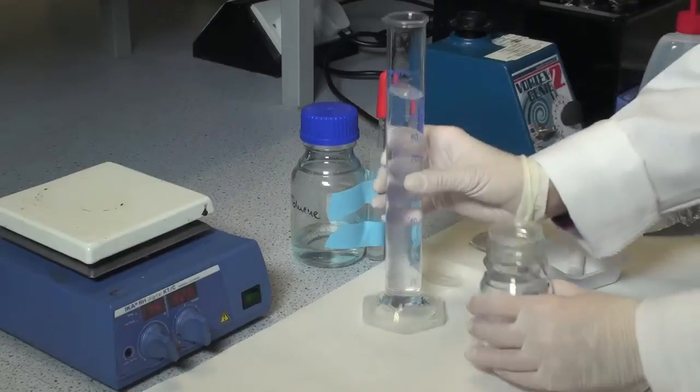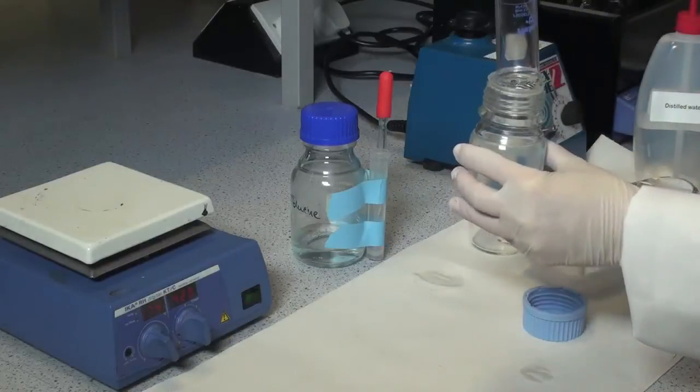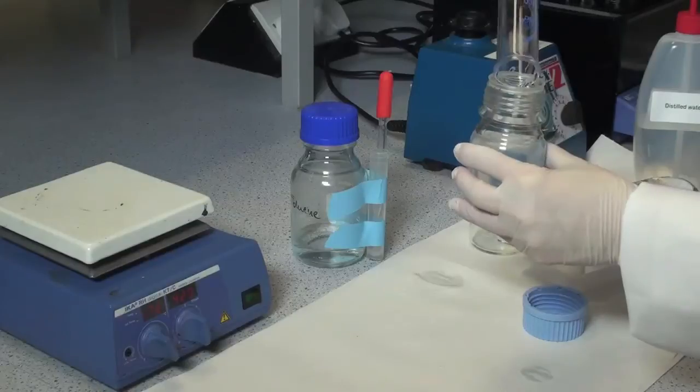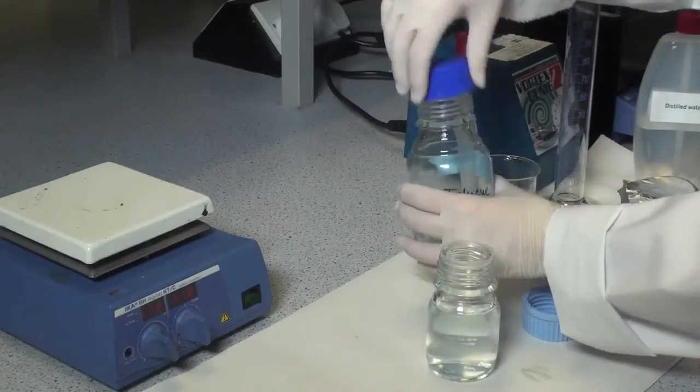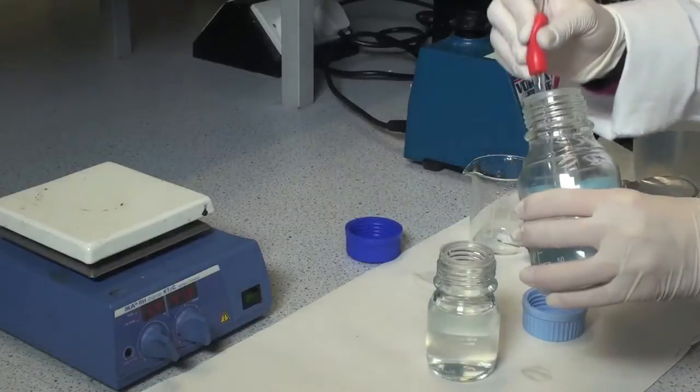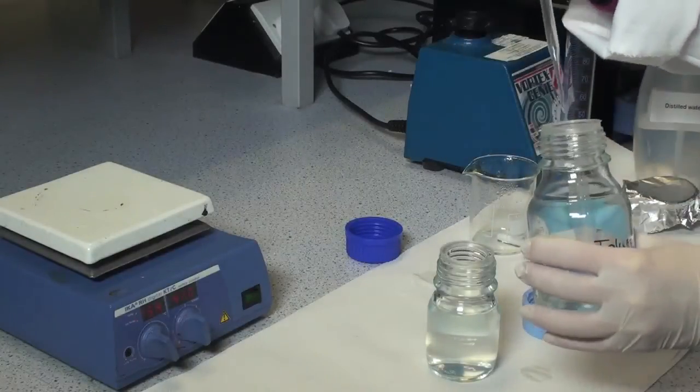Transfer this solution to a 100 ml Duran bottle and overlay the solution with 2 drops of toluene. This will prevent microbial contamination.